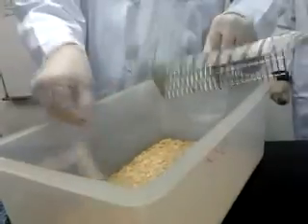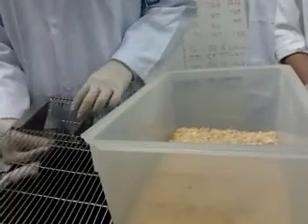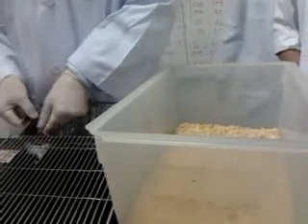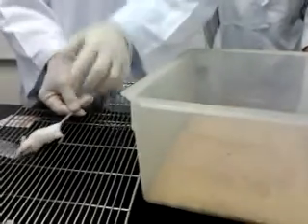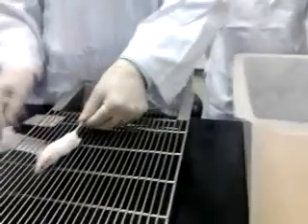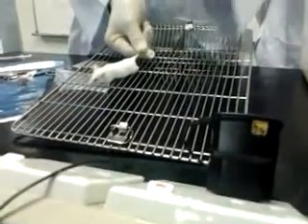Sometimes you want to restrain for IV, you can go to a hole. Sorry, yeah. There's a top here. If I'm going to use a cage top, basically we use this way to inoculate. But that's the old method. Animals tend to turn around. So what we're going to do is subcut. You place the animals on the bench, you see the hole. You do cervical dislocation this way, isn't it right? But now you're going to do subcut.